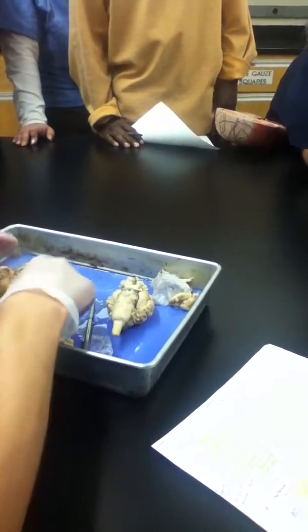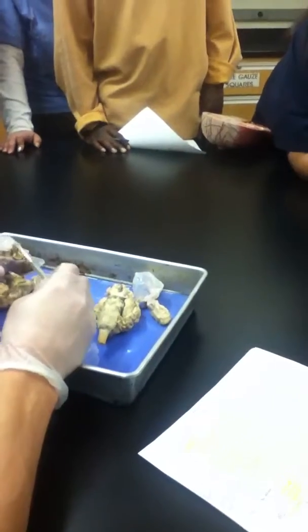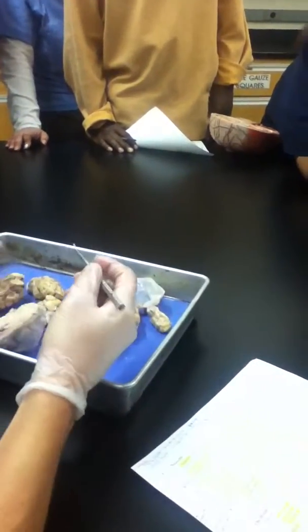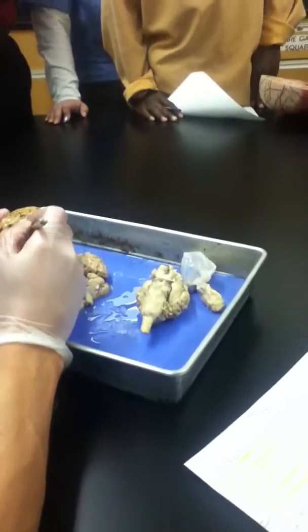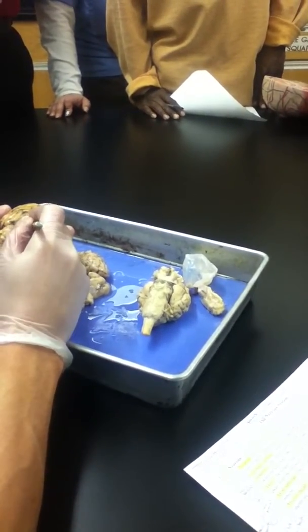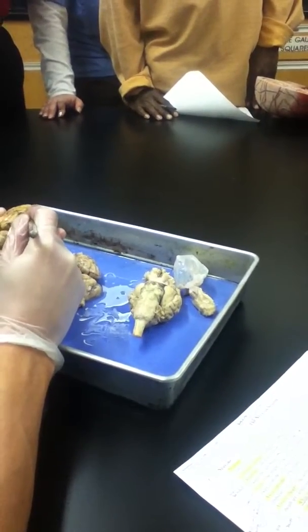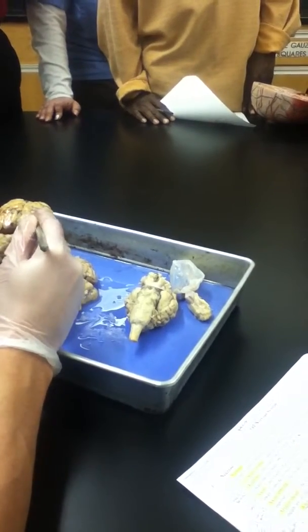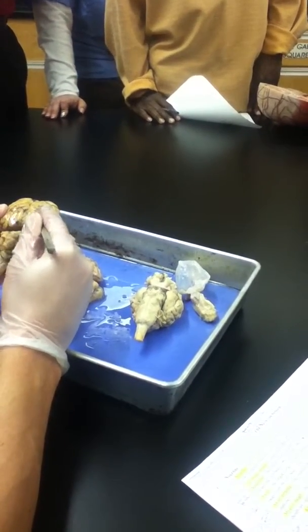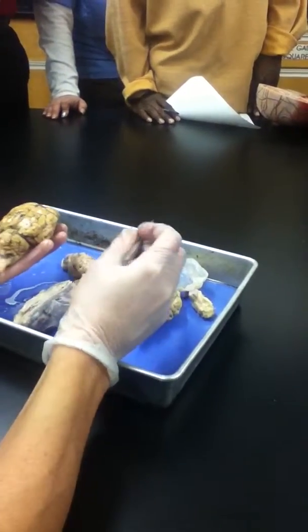But first off, what do you think it is you're seeing here? Exactly, you're seeing dura mater there, the thickest of the meninges right there. And when we take a whole brain, and I use the probe here to just barely lift it, there is a clear membrane, kind of as if it's been shrink wrapped. That's the pia mater. Notice how there's a clear membrane over the tip of the dissecting probe there? Sure enough, what I'm lifting there is the pia mater. All right, so there are those meninges that are visible here with the specimen.